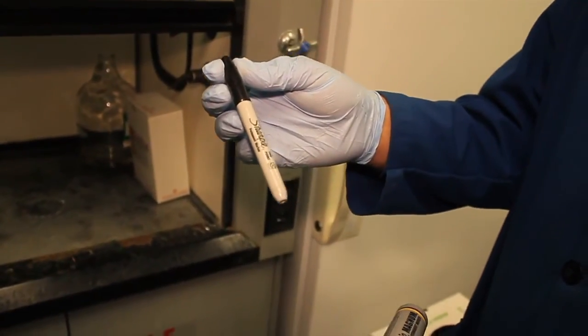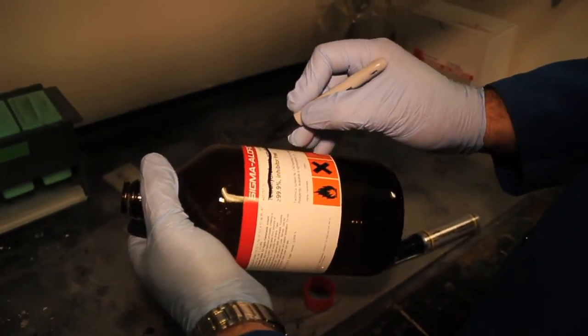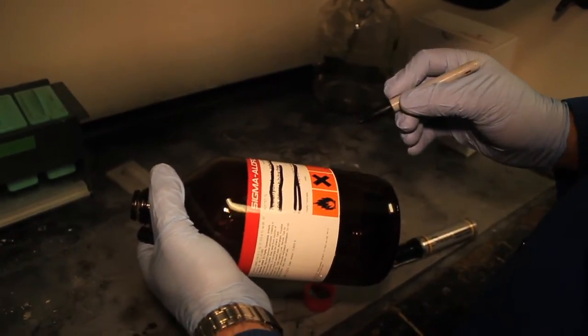Once you have finished rinsing the bottle, you must now deface the label. Make sure to deface all information that pertains to the last chemical.